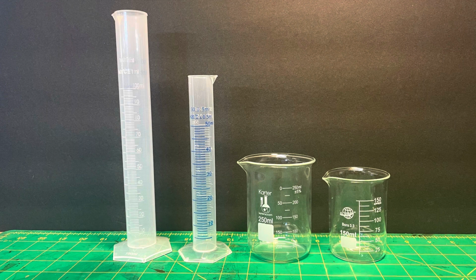For glassware and other materials here, we'll be using 2 graduated cylinders, one of which is 100 milliliters, the other is 50 milliliters. Then we'll also be using 2 borosilicate glass beakers. This doesn't really matter as much, just be careful with the kind of plastic or other material you use if you don't use borosilicate glass, as sulfuric acid can be sort of corrosive. In addition, not listed here, we use a little plastic stick to stir, and we also use a small scale to measure our mass of baking soda.